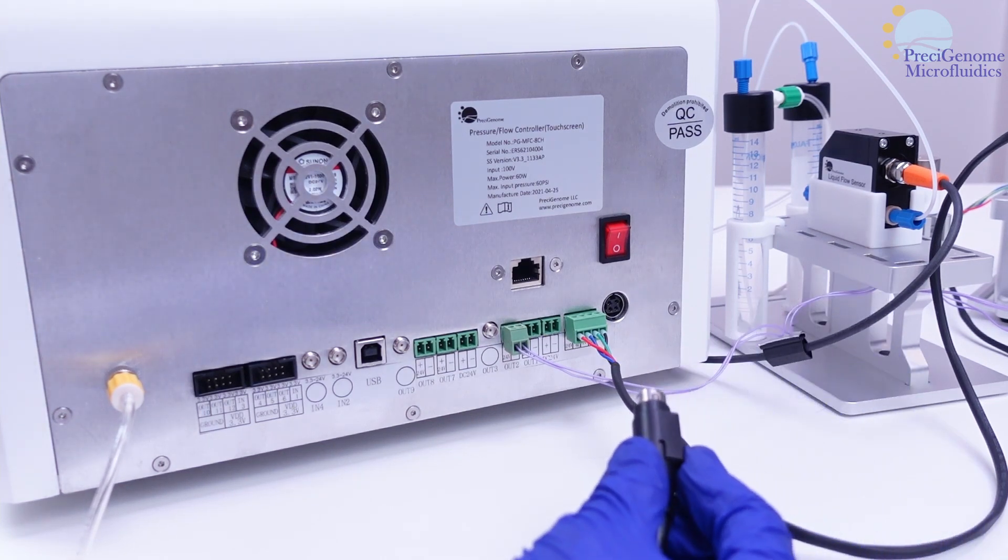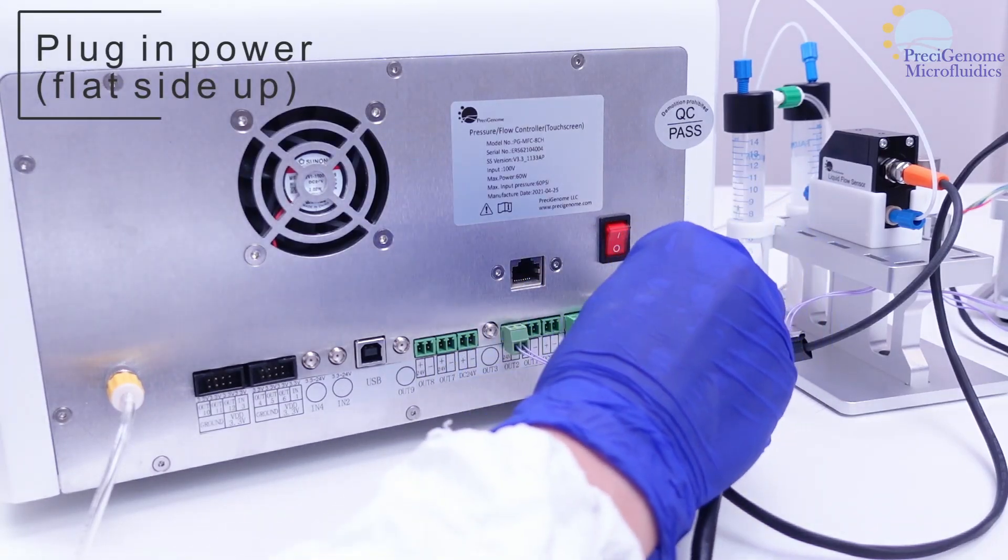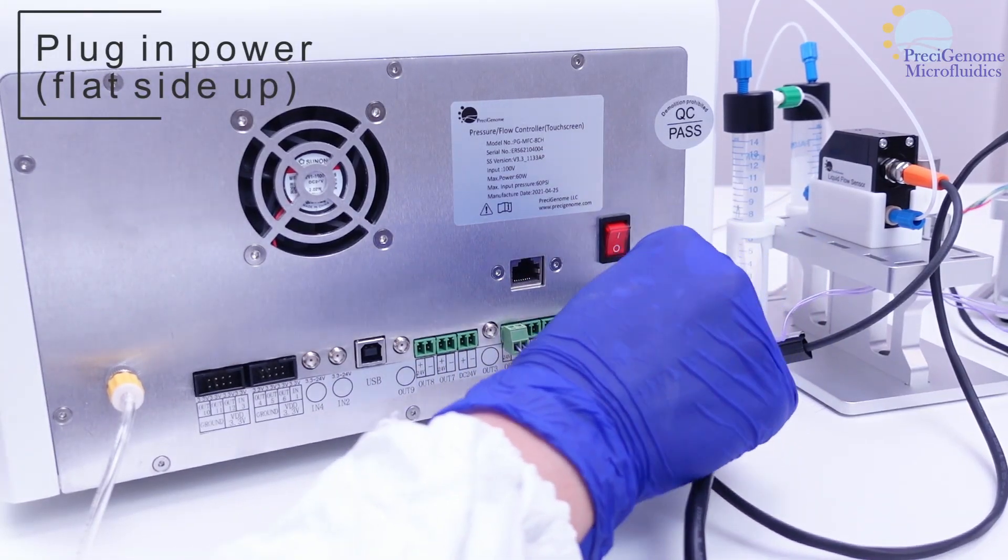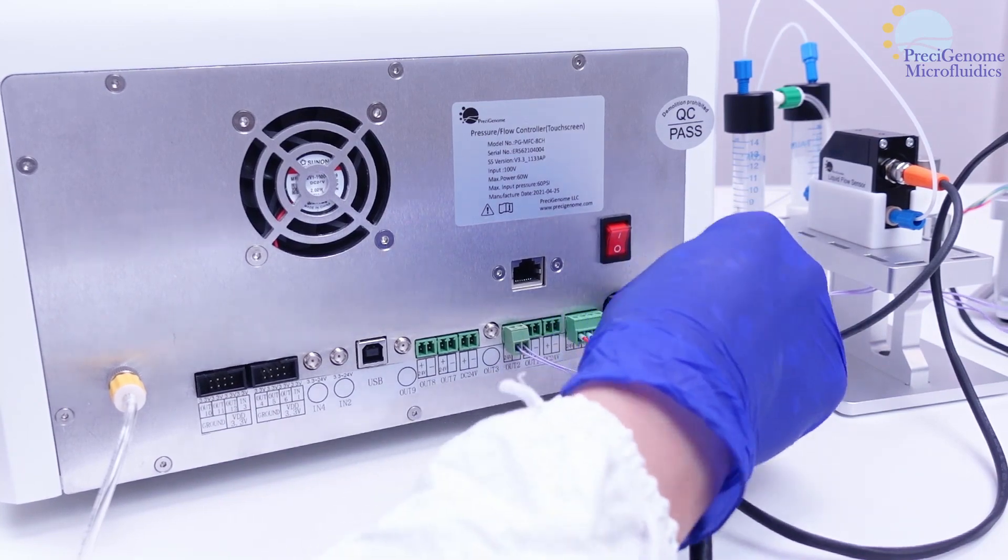Once everything else is connected, plug in the pressure controller's power cord. For using its built-in software, please see the respective video tutorial. Thank you.